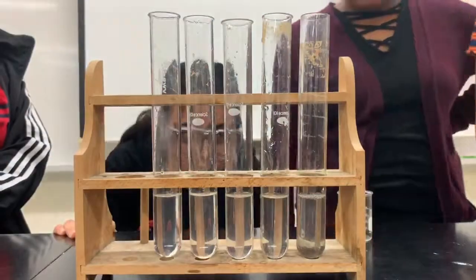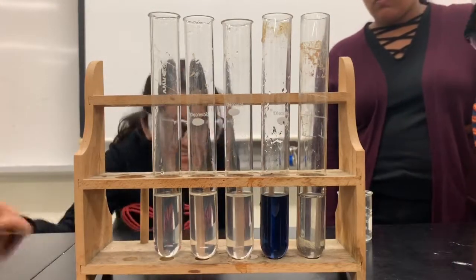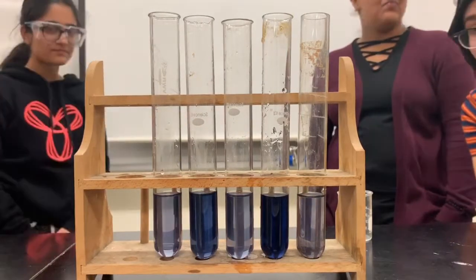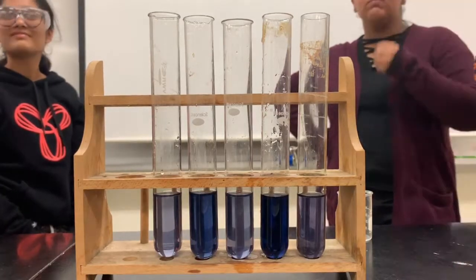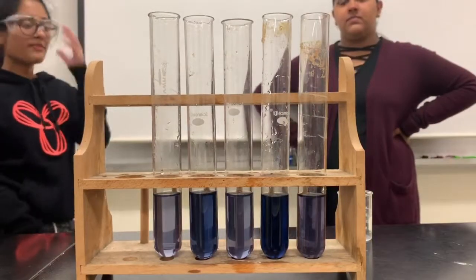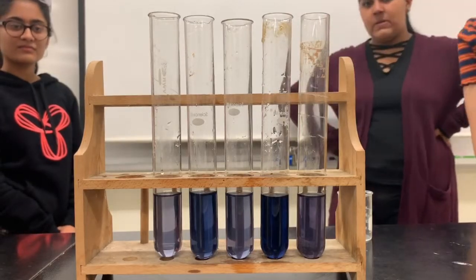Sources of error. One source of error in the experiment was an inconsistency in time for reaction pouring, which resulted in one of our trials displaying inaccurate results. This in turn caused an inaccuracy in the reaction time for certain solutions, as a color change was observed for test tube 2 and 4 before the others, even though they consisted of lower concentration than test tube 1, meaning they should have had a longer reaction time in comparison to 1.